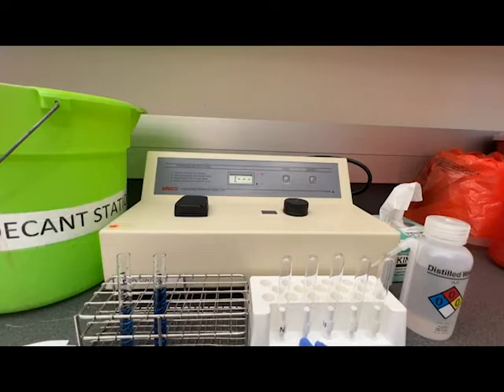The tubes that we use to make our samples often have imperfections due to scratches or the quality of the glass, so it's best practice to use cuvettes that are designed for spectrophotometers.